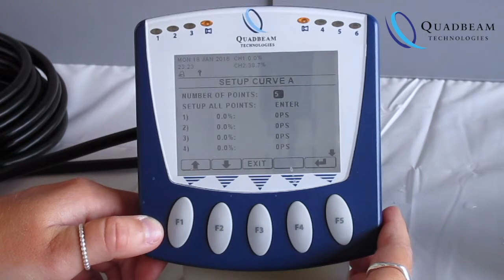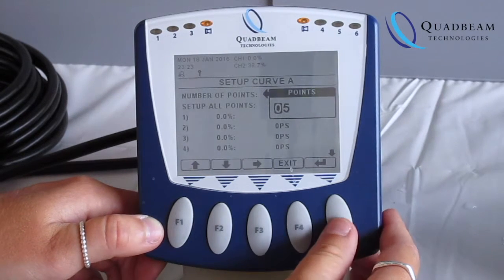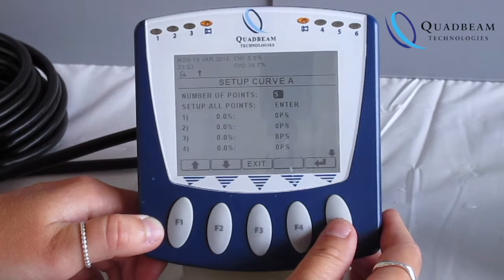We've chosen five points, that's a good number. Three is okay, five is better, and ten is quite extreme - you'll get outstanding results from that.